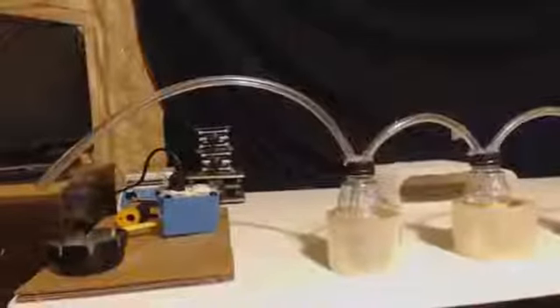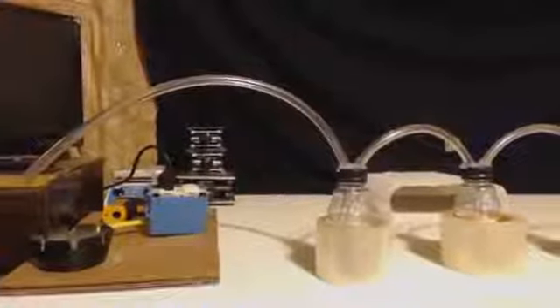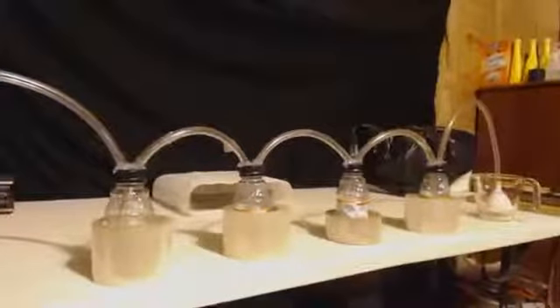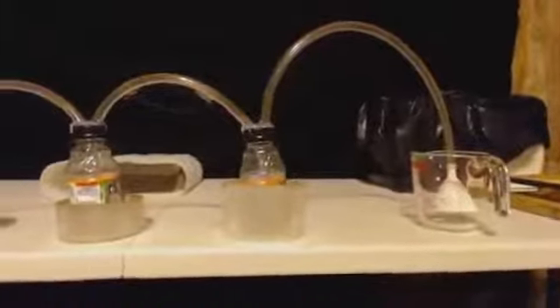Okay, now I had a whole bunch of rolls of tape, so I used them to sturdy the apparatus out. I put all the tubes in. As you can see, to the left would be the apparatus. It comes out the tube, goes in the first bottle, then the next, all the way down to the funnel. When you're ready to actually use this apparatus, you can put a stick or a scissors or something across that cup there, right? Tape it to the cup so it doesn't move.